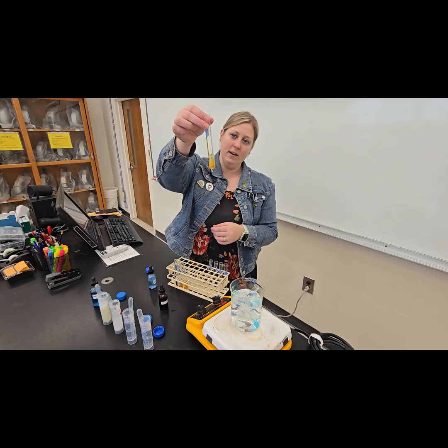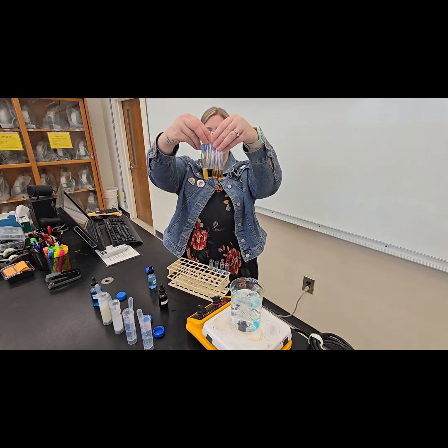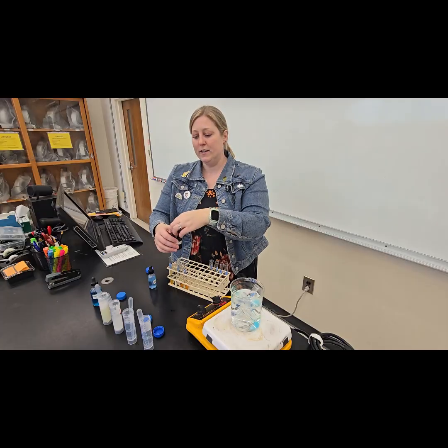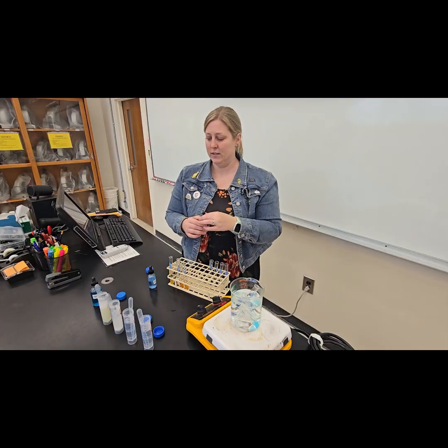And so again, that yellow kind of color. So we are seeing here three negatives and a positive test result, which is expected. Starch should be our positive test result and should tell us then, if I test an unknown food item and it turns a dark color in the presence of iodine, we have starch present.